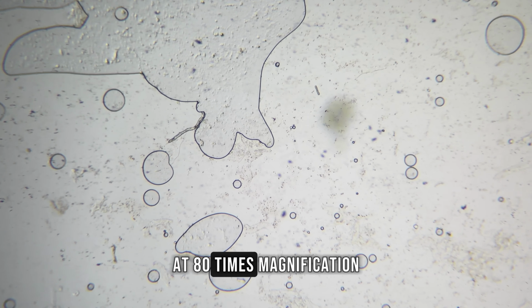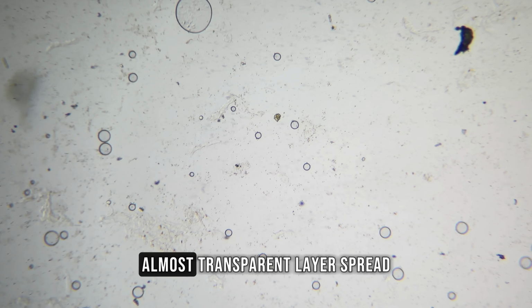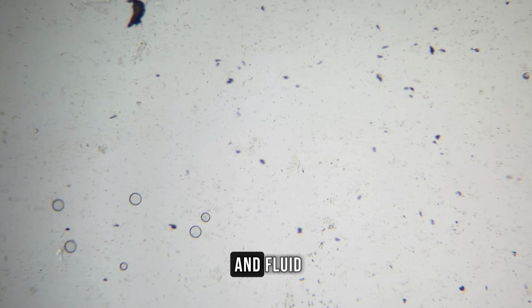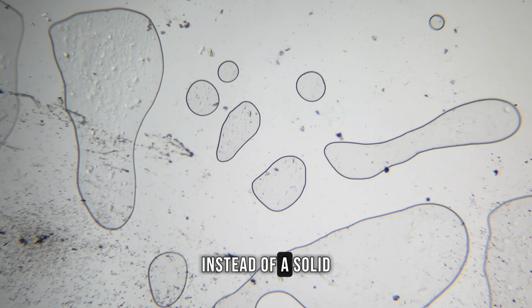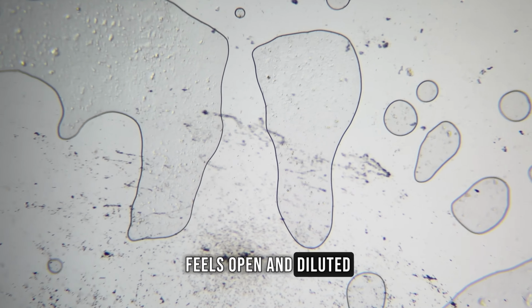At 80 times magnification, the mandarin sample appears as a very light, almost transparent layer spread across the slide. The surface looks uneven and fluid, with large, empty-looking regions dominating the field of view. The familiar, juicy texture of the mandarin disappears almost immediately. Instead of a solid fruit structure, the image feels open and diluted.